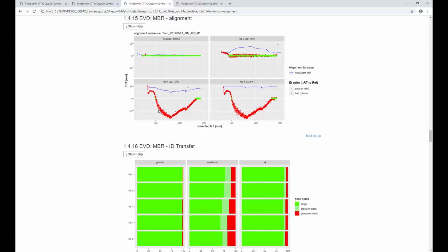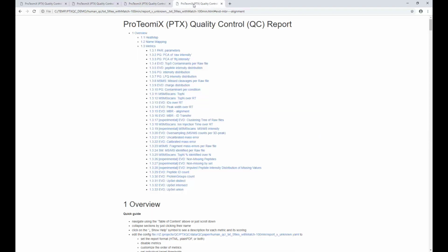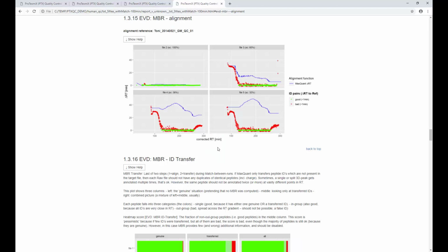Now, this is quite an extreme sample, but if you measure a large cohort on a single column, this might be something that would happen to you. What do we do about it? Well, we run MaxQuant again, but just with a larger threshold to allow it to correct larger retention time differences. And this is basically what I did here. So I changed the MaxQuant parameters, ran it again, and if we now look at the alignment, I think I allowed 100 minutes, which is really extreme, but MaxQuant now should be able to correct the retention time of all our raw files and align them perfectly.